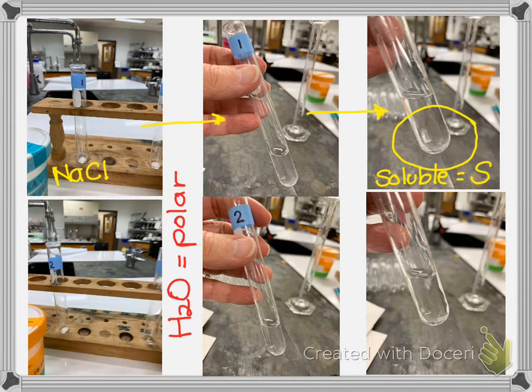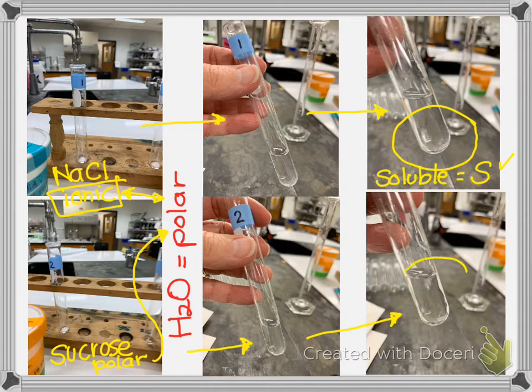The second, number 2, was sucrose. And let me go back up to this one. So sodium chloride is ionic and water is polar. So they are similar. So we would expect it to be soluble. That's like dissolves like. Sucrose is polar. So what do we expect? Like dissolves like. So if I put sucrose in water, I would expect it to dissolve, and that's what happens. So here's what it looked like from far away. And then looking here, all the sugar dissolved. And so I would say it was soluble.